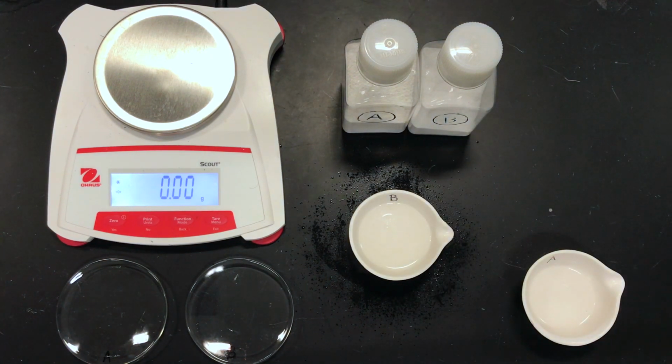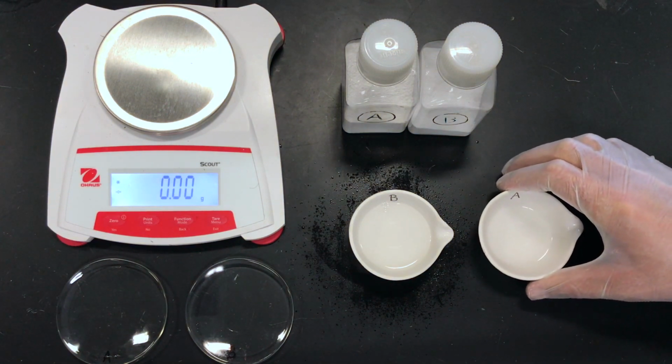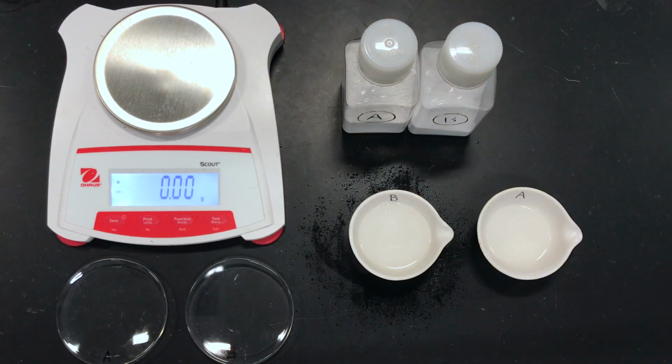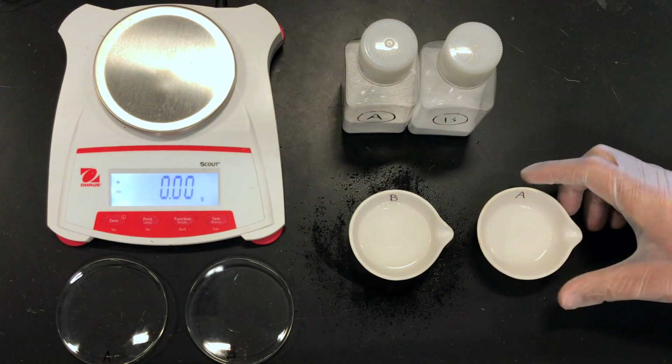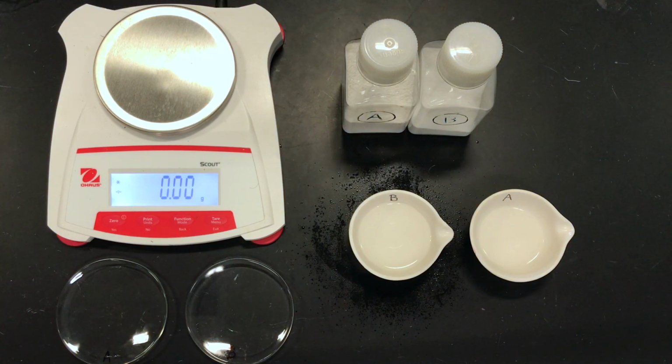Okay, no more visible fizzing. Okay, so I have driven the reaction to completion, and now I have essentially sodium chloride solutions here. And we're going to have to measure out our dried sodium chloride, so now we're going to heat. Now also, we probably most definitely have excess hydrochloric acid that we will also boil off, as hydrochloric acid actually is a gas dissolved in a liquid.